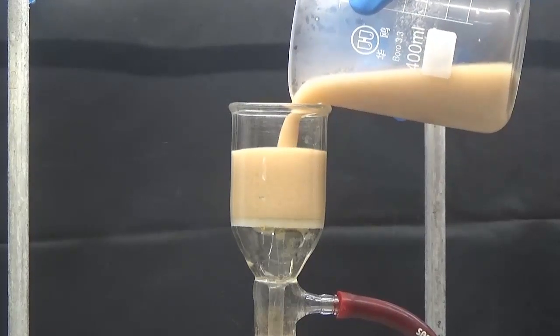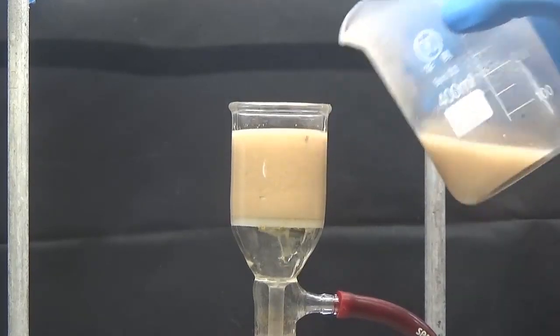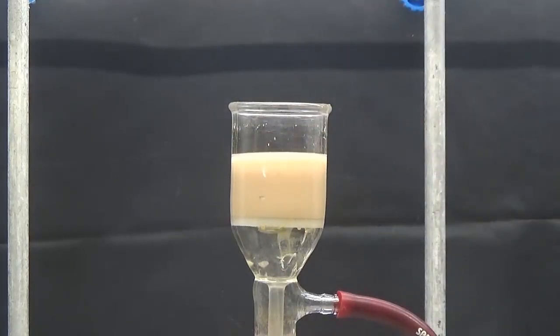Collect the precipitate by suction and wash 4 times with 10 ml of cold water.